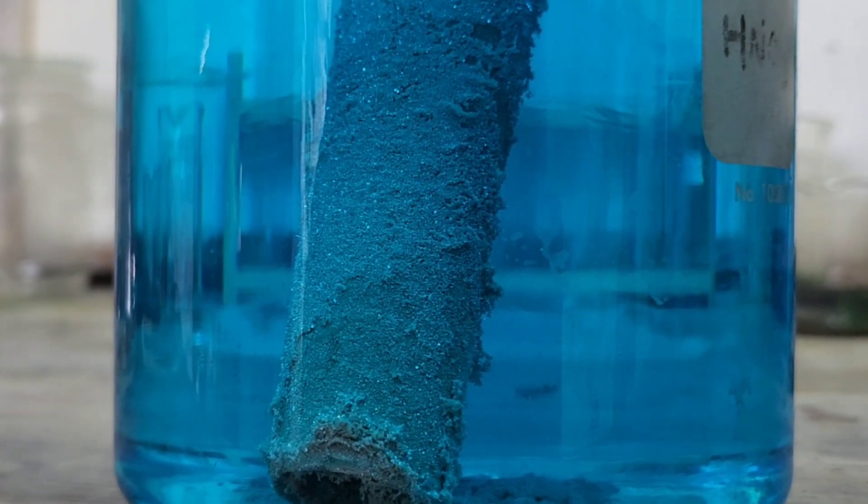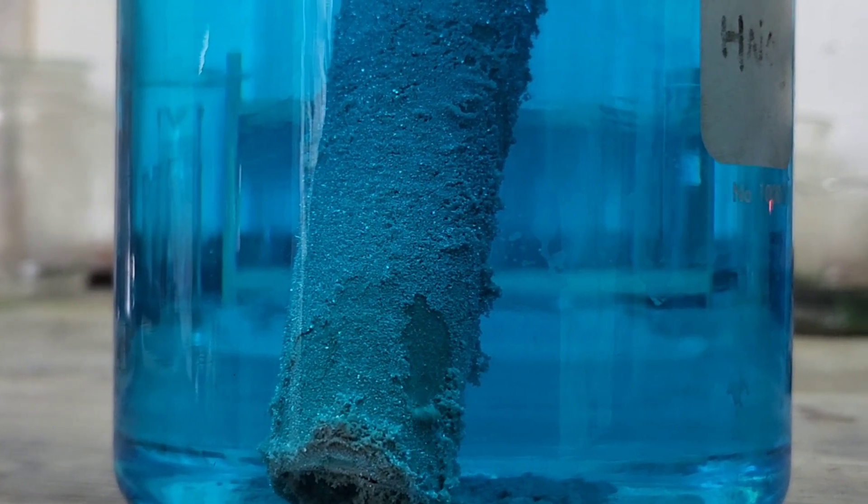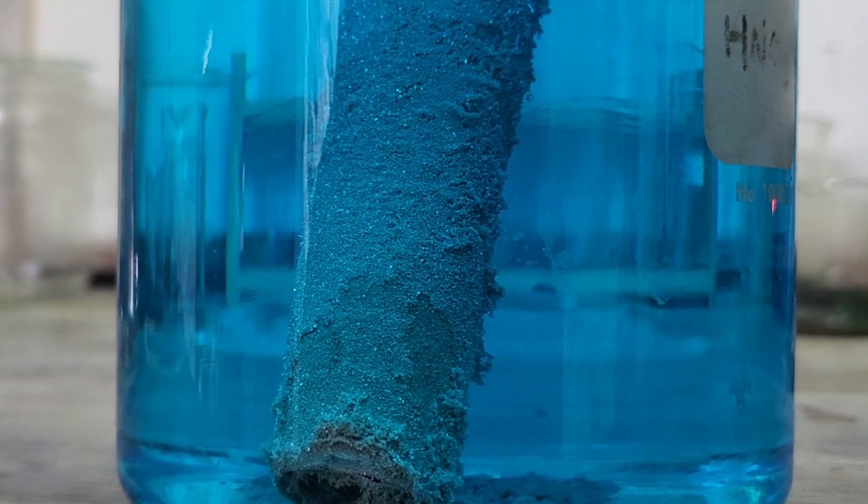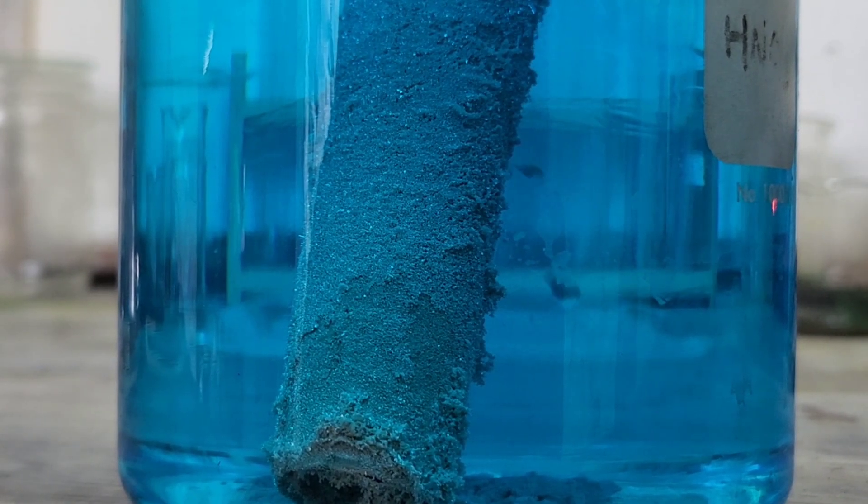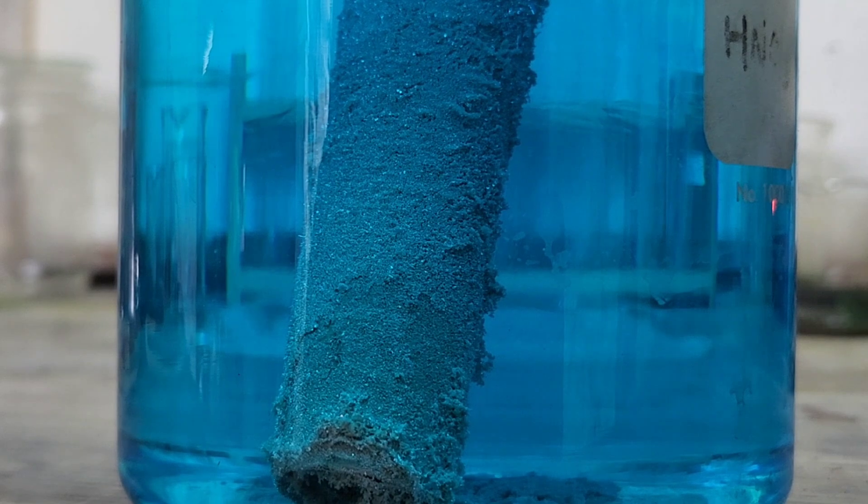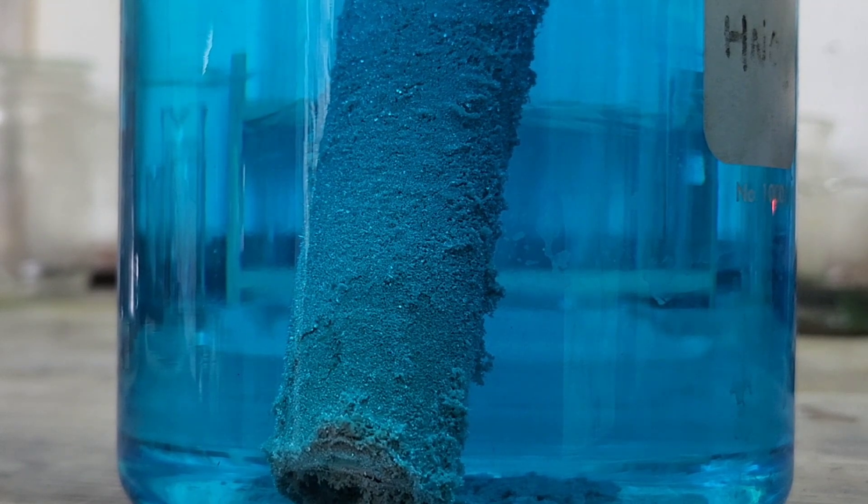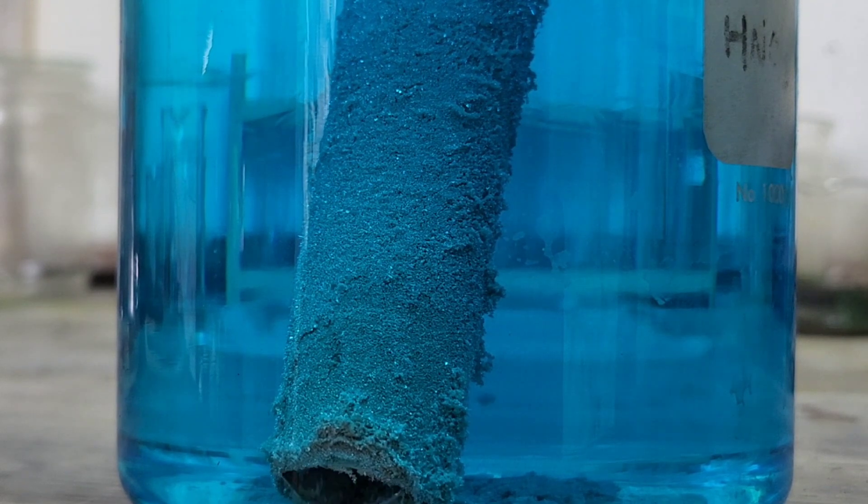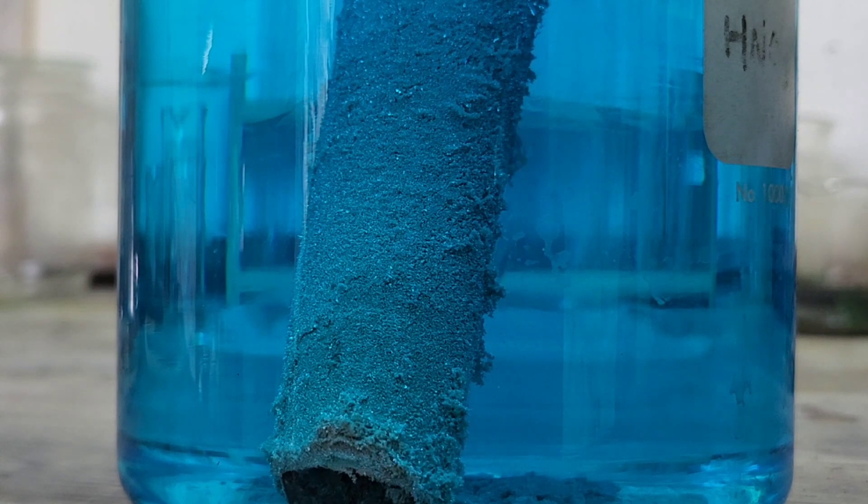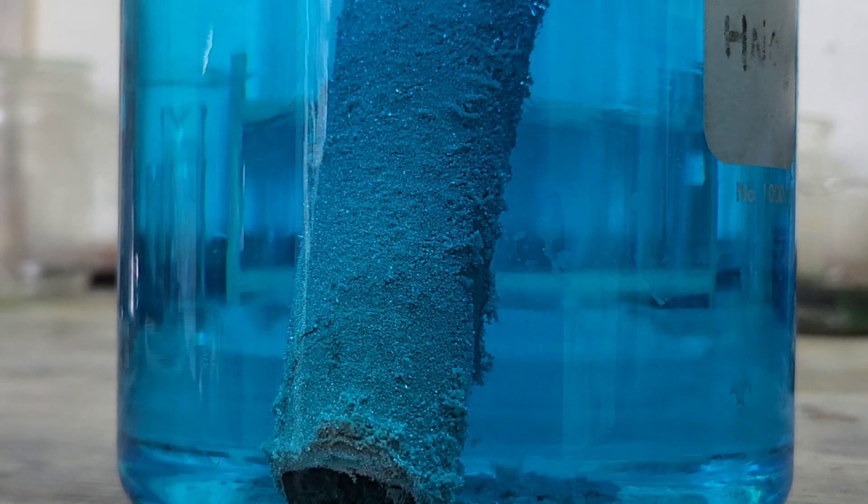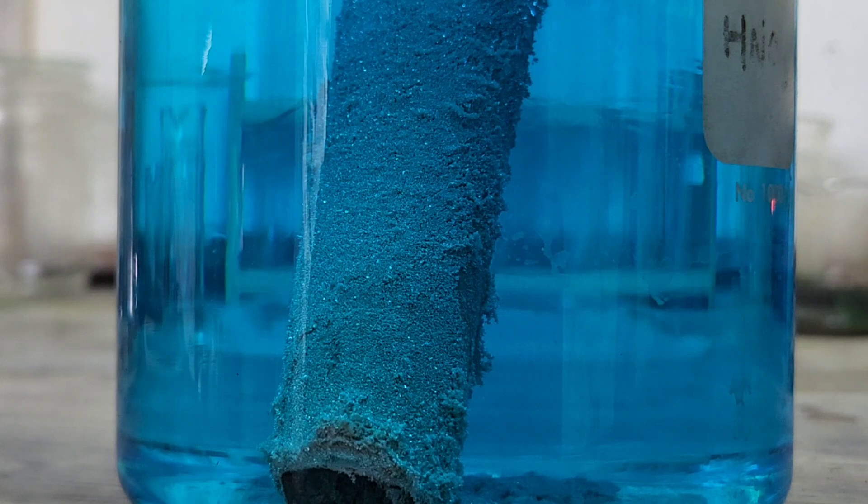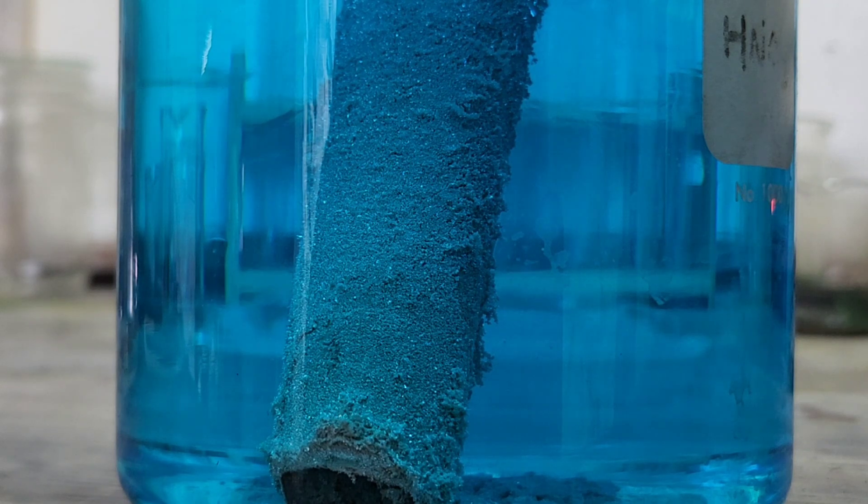Well, while this is doing its thing, we'll take a look at it tomorrow. We've got a decent amount of distilled water. We've got it diluted enough. We can see the silver rolling off of our copper quite nicely, so we know it won't passivate. I think we're going to have a good chunk of silver here tomorrow.